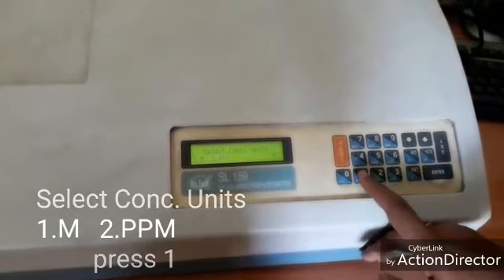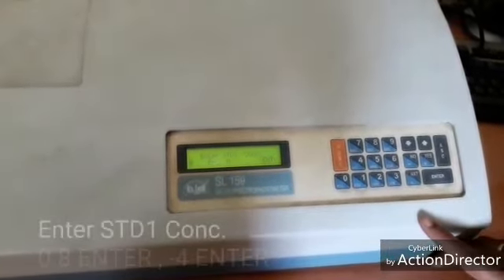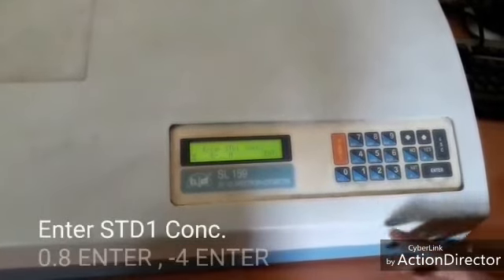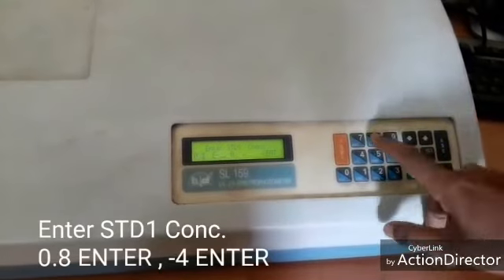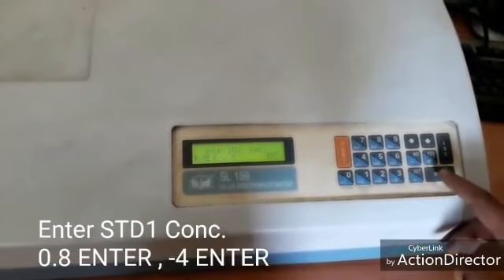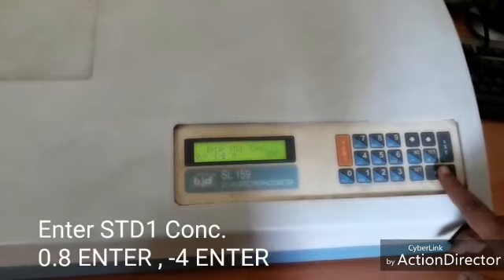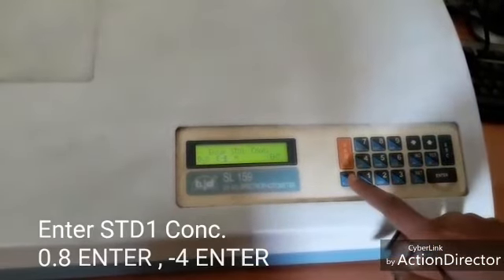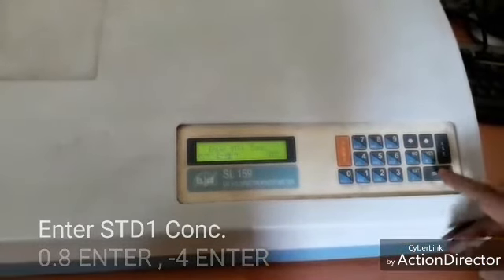Select concentration unit. We are calculating molarity. Press 1. Enter standard 1 concentration: 0.8. Then enter. 10 to the power of minus 4. Then enter.